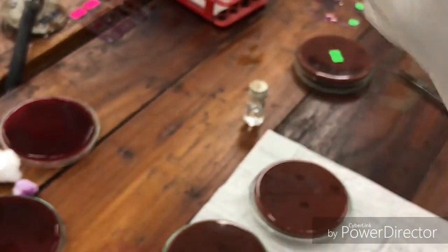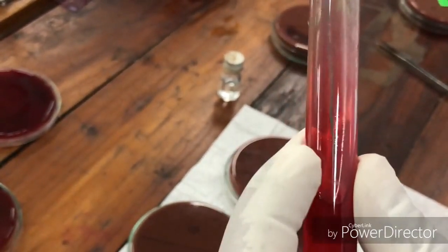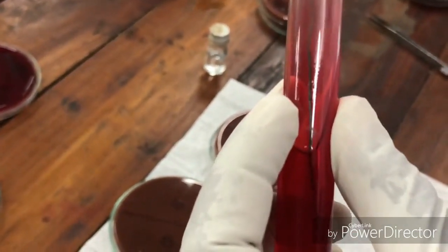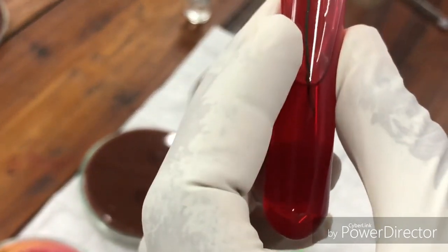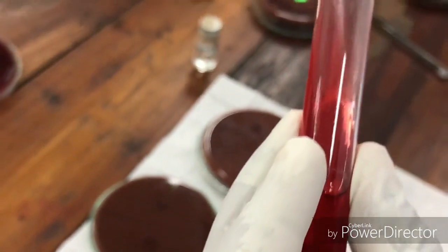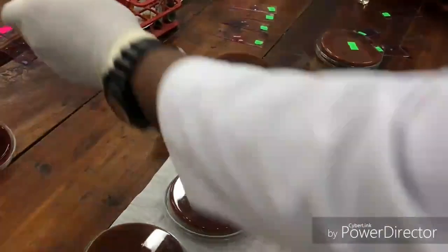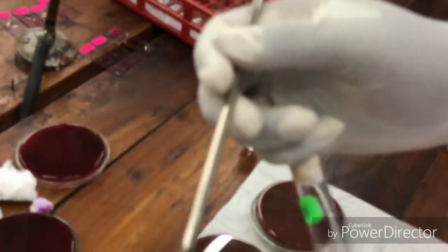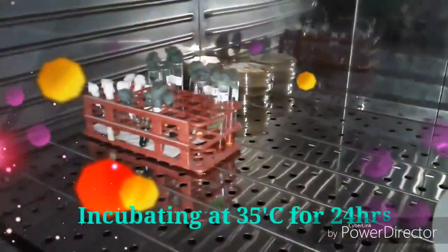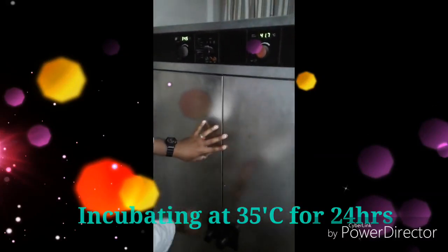The KIA slants have a butt and slant position. Firstly, we introduce the colonies by stabbing into the butt position, then streaking onto the slant surface. After introducing the organisms, we incubate the tubes at 35 degrees Celsius for 24 hours.